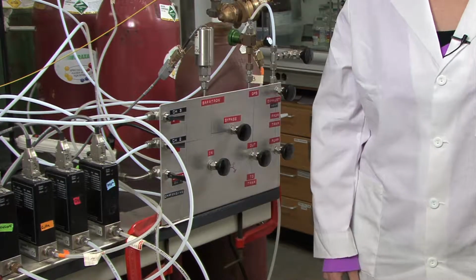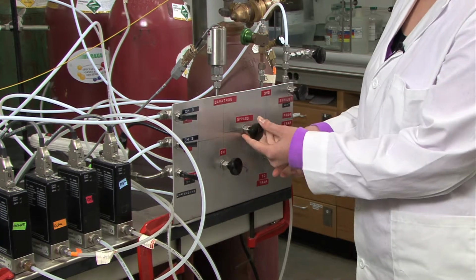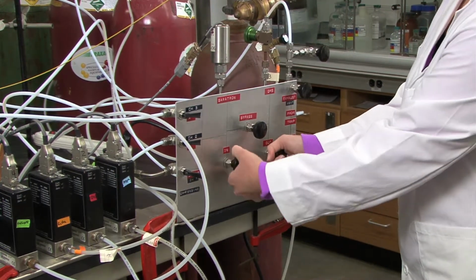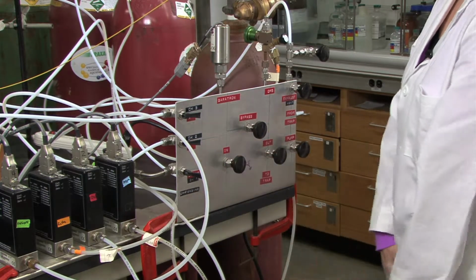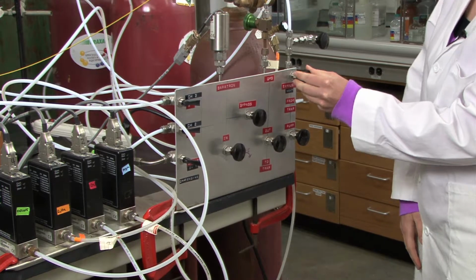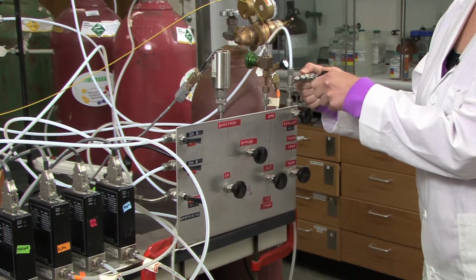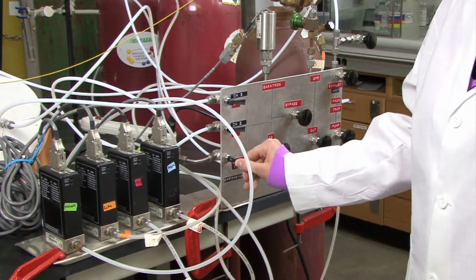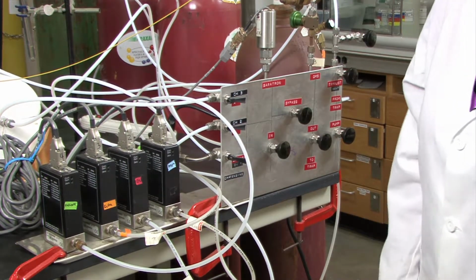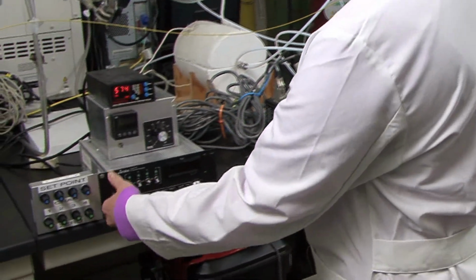So when you get to lab, you'll need to make sure that the bypass is turned on and the in and out valves are turned off. Make sure that the exhaust is turned on and the pump valve is turned off. And then the atmosphere vent valve is turned off as well. Toggle 1 should be on, and then you're going to want to go over to the 247 channel readout and turn that on by pulling out on the knob and pushing up.